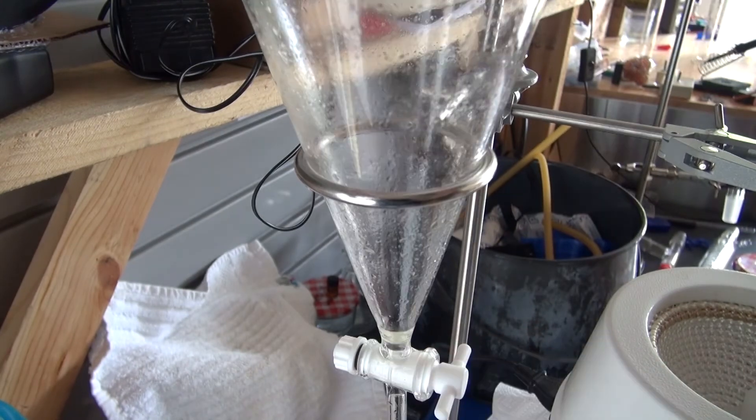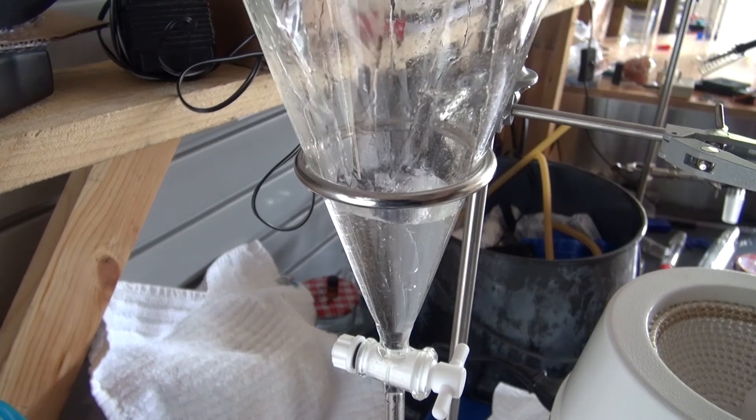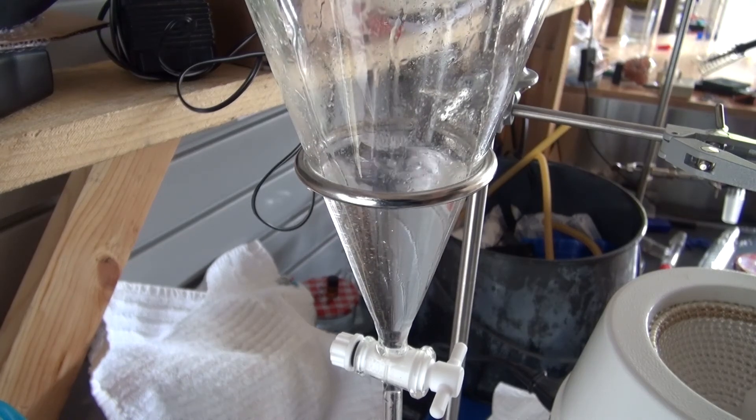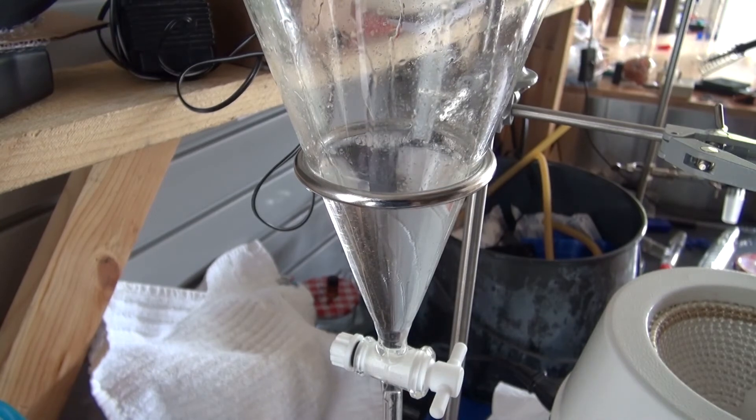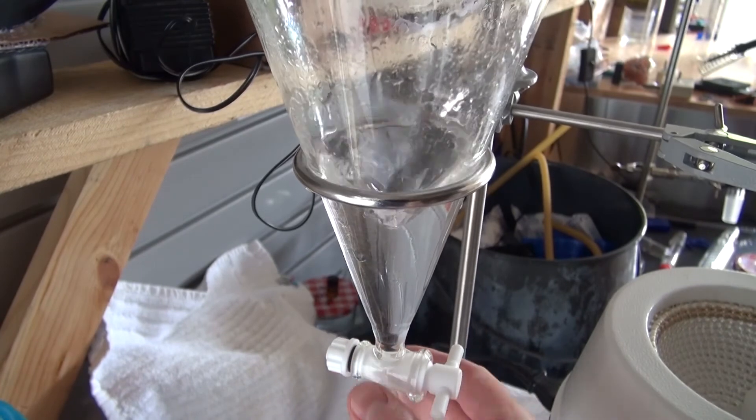Now I'm going to pour some more distilled water inside to wash off the sides. Shake it up a bit to get all the rosemary oil off on the side.